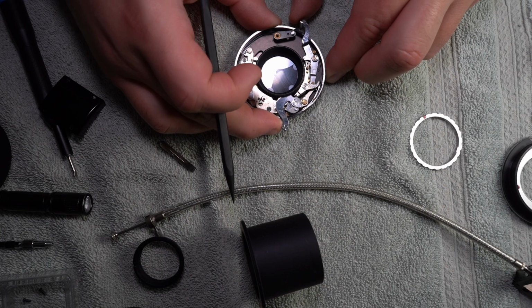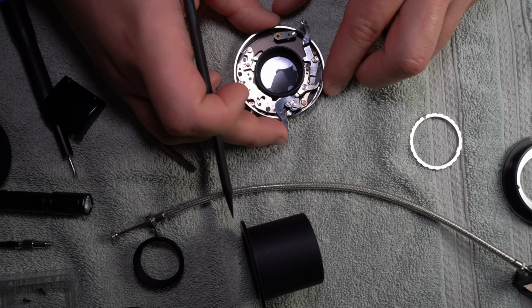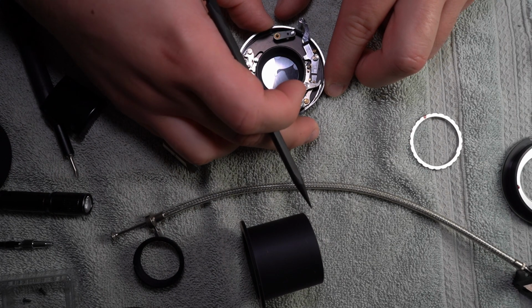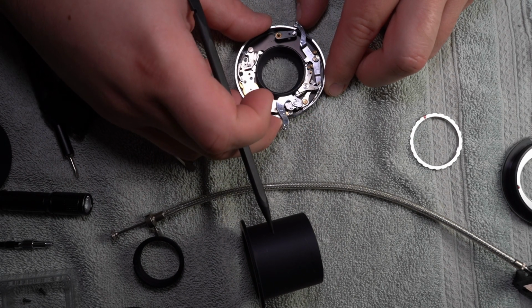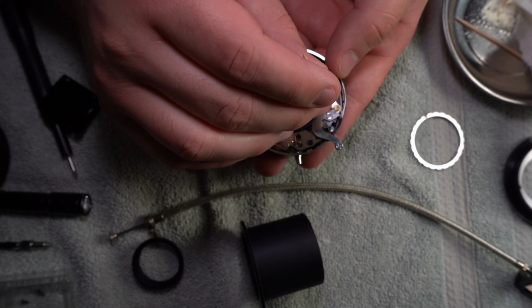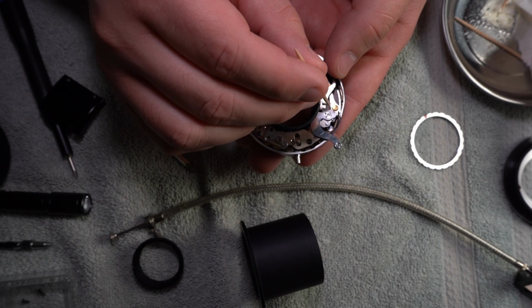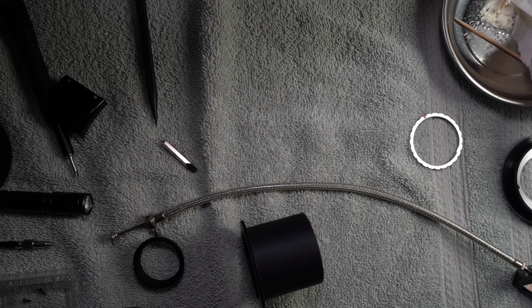I'm just gonna play with this and see what does what. Yeah. So this part, and that part which is hidden, grease those two things real quick. Now I'm gonna try and do this while you can see me, but I'm probably blocking this whole thing. And now I'm totally off camera, but take my word for it, I'm doing it.